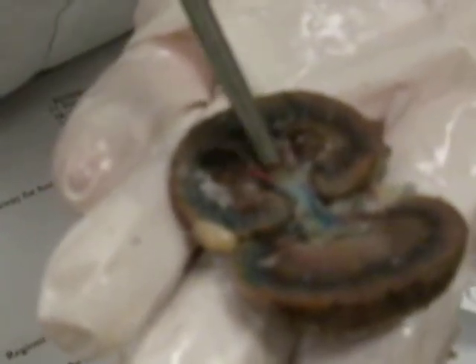Oh, nice. Okay, so you can see these U-shaped areas here. The U-shapes actually define where the pyramids are. And the very edge of that U is going to be the calyx, or the calyces, multiple ones. So that's where the filtrate's going to get to and then start to form and then go into the pelvis, and then it goes out to the ureter.